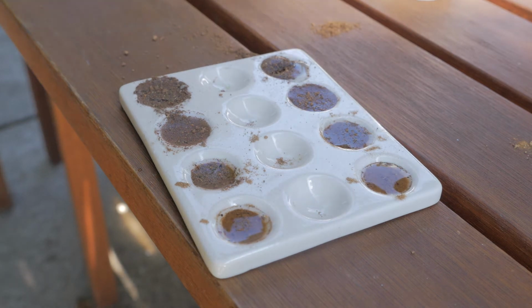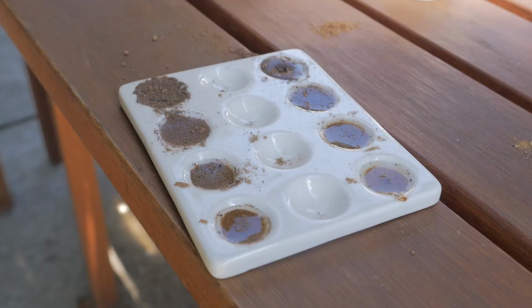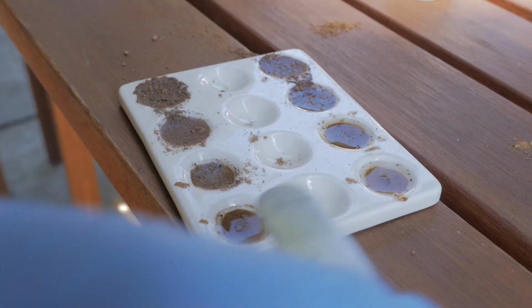Now we'll mix up the sodium fluoride. Get that reaction going, reacting with those awesome, poorly crystalline, long, dendritic clay minerals. All this surface area, holding on to all this organic matter and different anions. Just wild clay minerals. Sodium fluoride, 1-to-1 water.